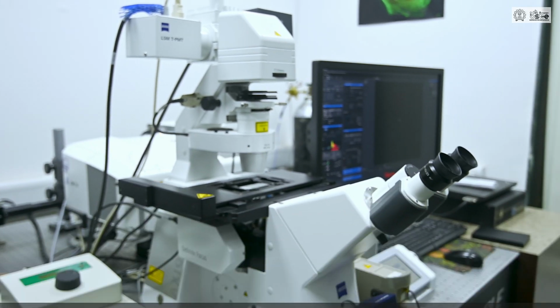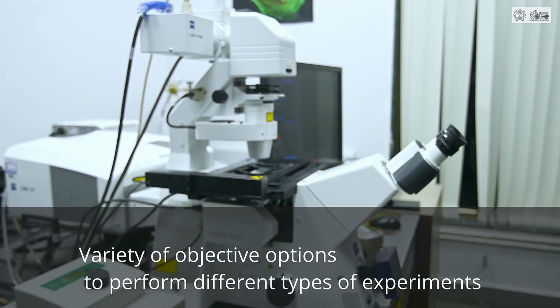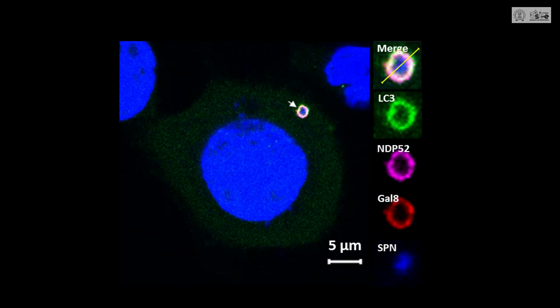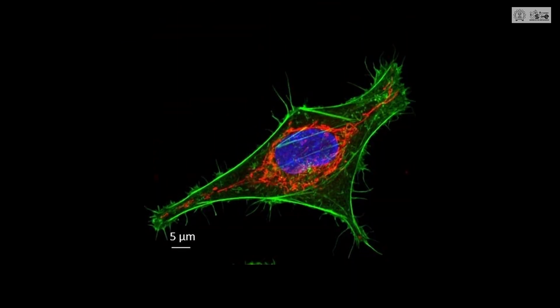It offers a temperature and carbon dioxide controlled incubation stage for long-term live cell imaging and a non-descanned detector for use with the multiphoton laser for deep tissue imaging.